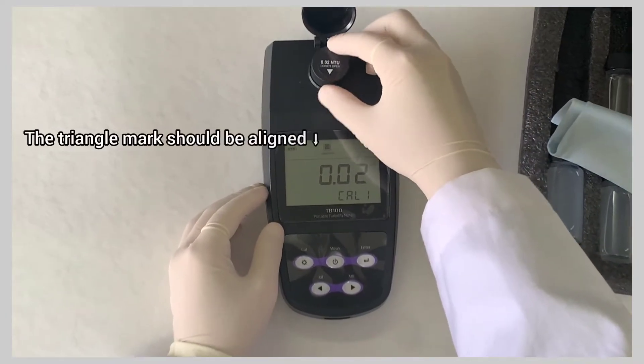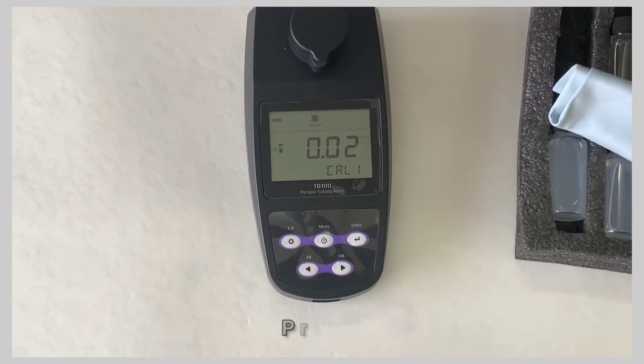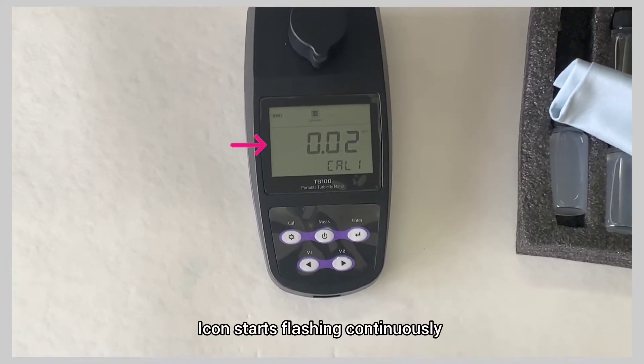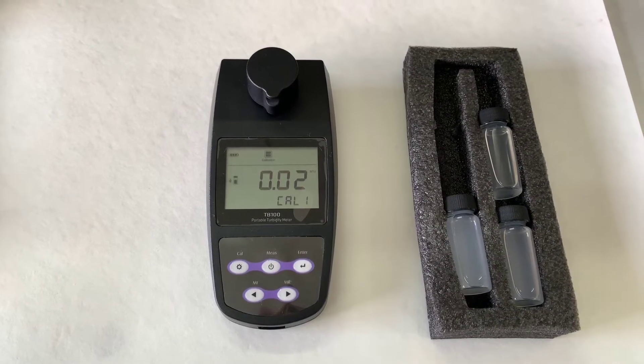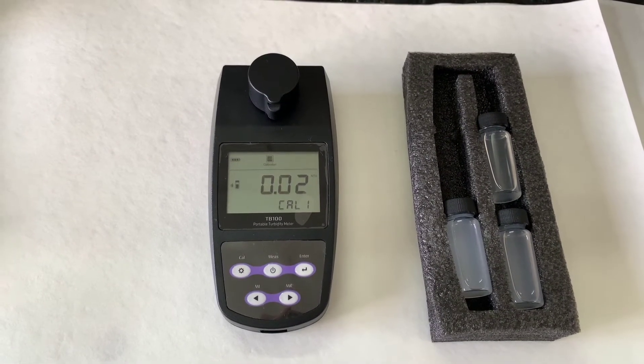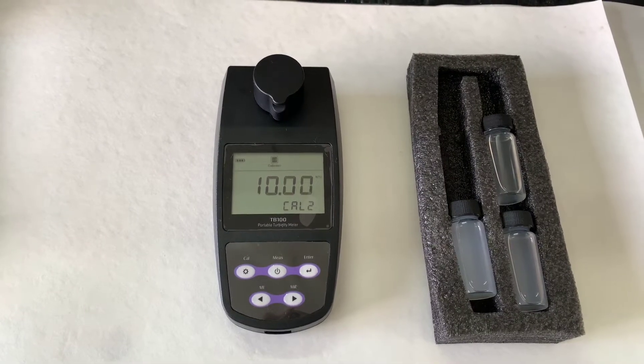The triangle mark should be aligned downward. Press enter. The icon starts flashing continuously until the measurement is completed.